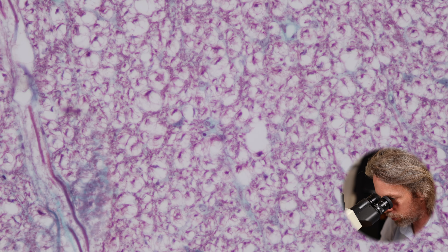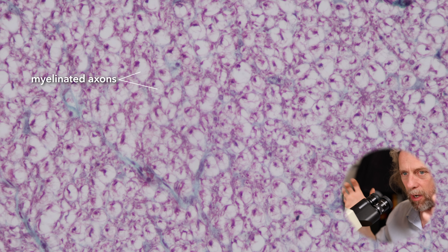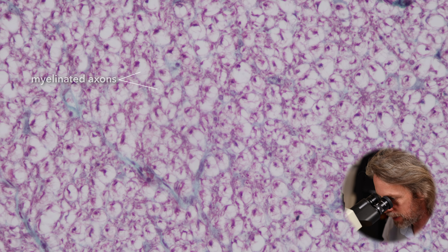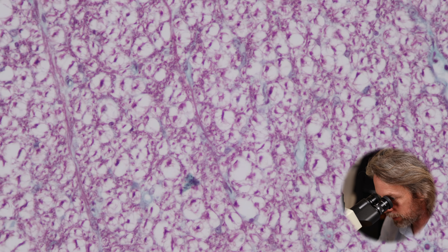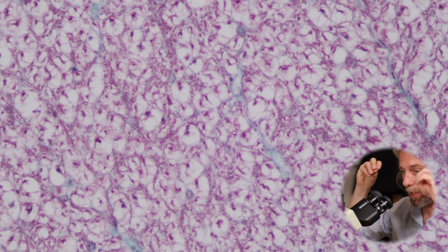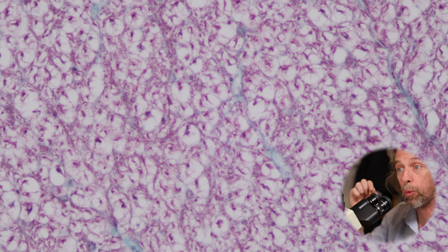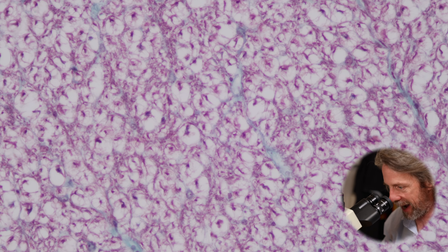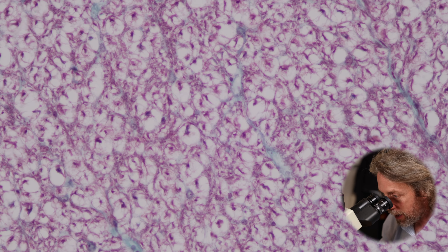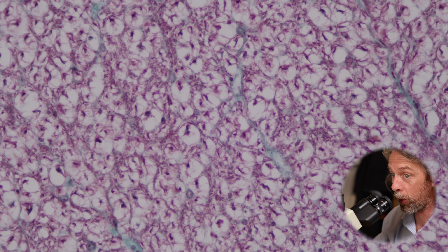Just look how many axons and neurons there are — this is all white matter, all information flowing up and down the spinal cord. One oligodendrocyte might wrap myelin around three, four, five, six, seven nearby axons, but because the axon is so long, you'll need lots of oligodendrocytes running the length of the spinal cord. The larger the diameter of the axon, the faster action potentials can be propagated. With myelin sheaths you can have a much smaller diameter axon and still have much faster action potentials.